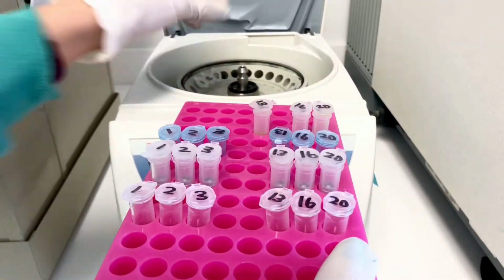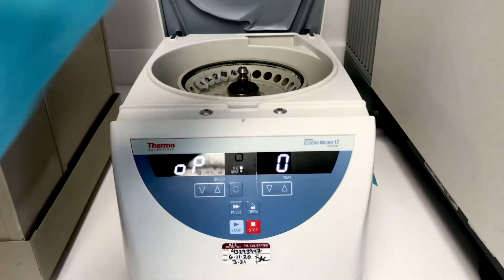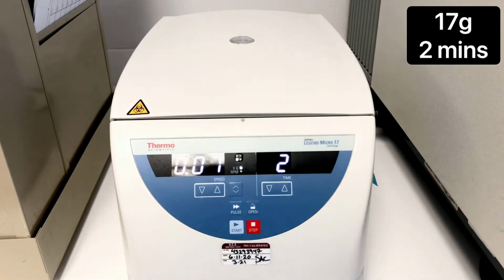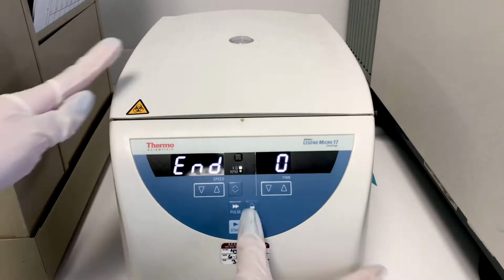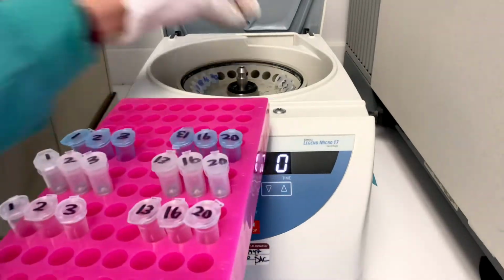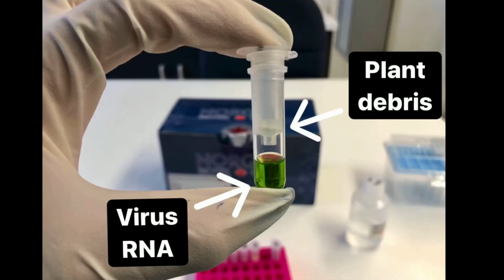Next, we are going to load our tubes in a microcentrifuge and spin it for 17 Gs for 2 minutes. Once the spin is complete, remove your tubes from the microcentrifuge. The filter column is designed to separate the plant debris while the virus RNA filters through.